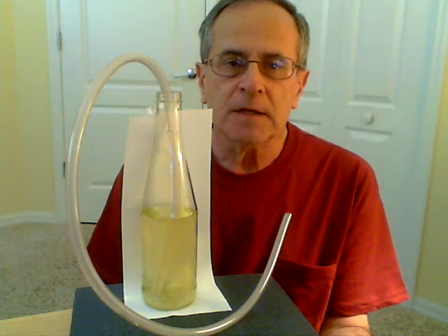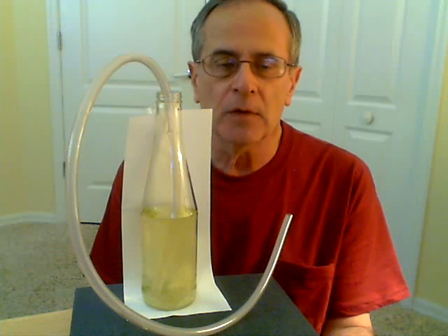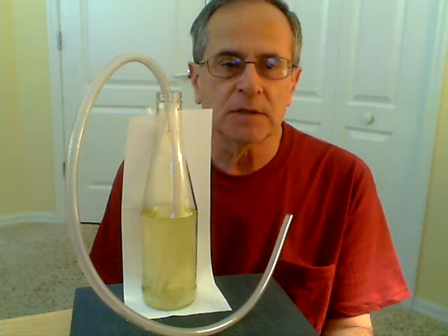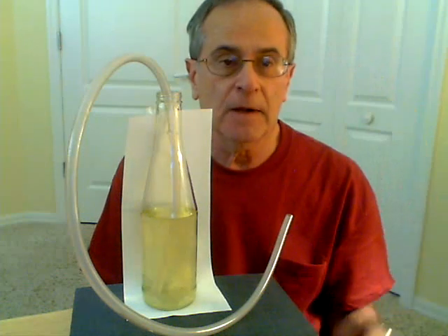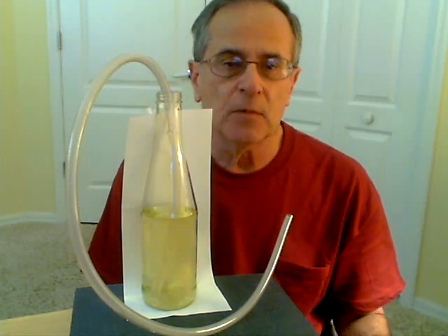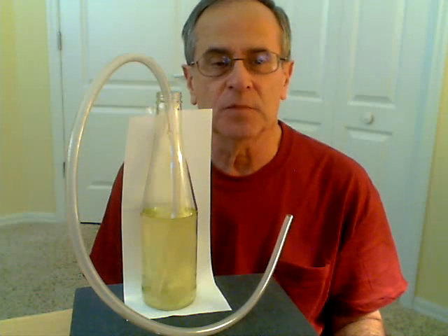So this is a nice, very simple demonstration to illustrate that when we exhale, there's more carbon dioxide in the air we exhale — about 4% compared to the air we inhale, which has 0.04%, so about a 100-fold increase due to our respiration. It's a very simple demonstration to illustrate that there's carbon dioxide in our exhaled air, and that carbon dioxide is an acid. One could do various variations on this — just pump carbon dioxide into the solution, or add some acid to show that it goes from purple to yellow, and so forth.